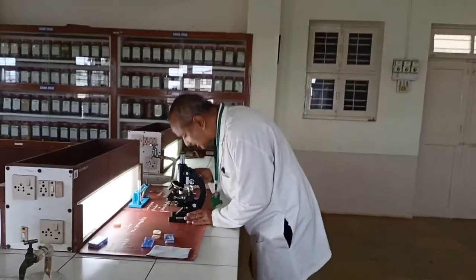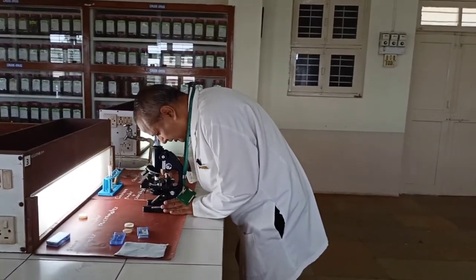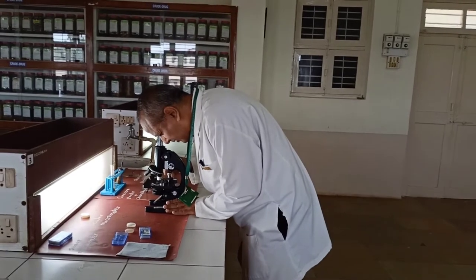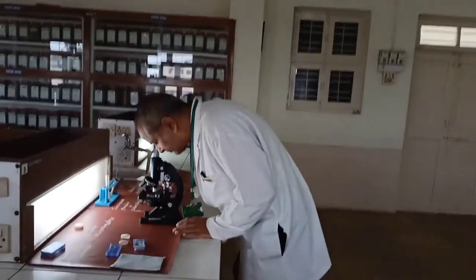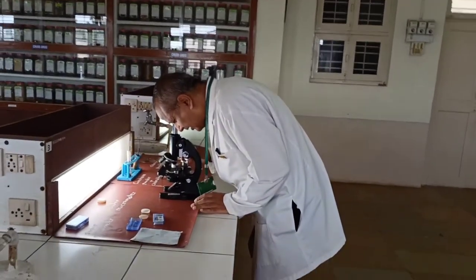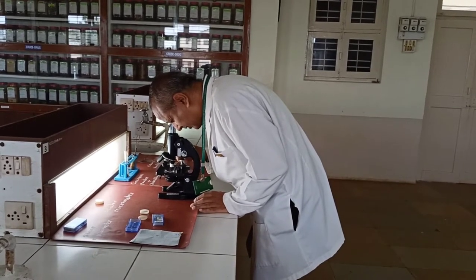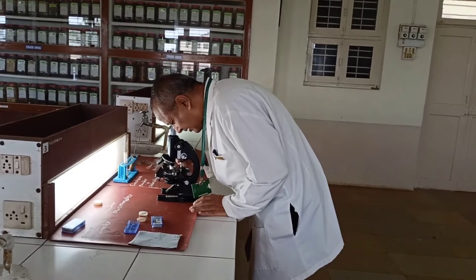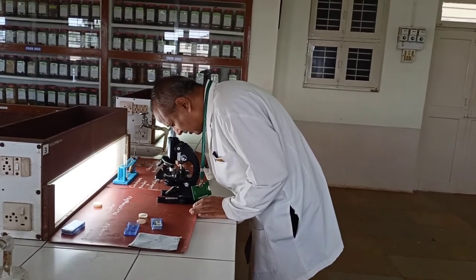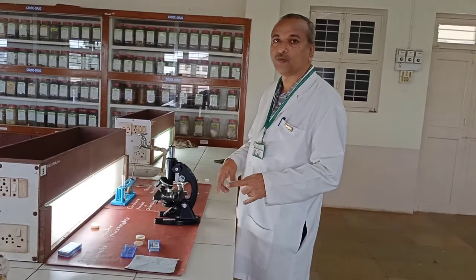We have already demonstrated the superimposing of the stage and ocular micrometer scales. Here, the 10th division of our stage micrometer is coinciding with the 7th division of our ocular micrometer, and that is how it is focused here.